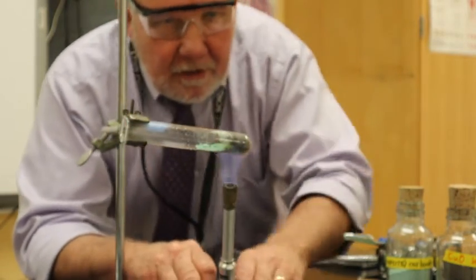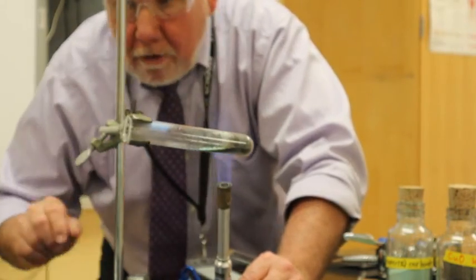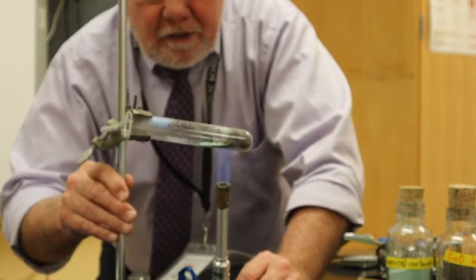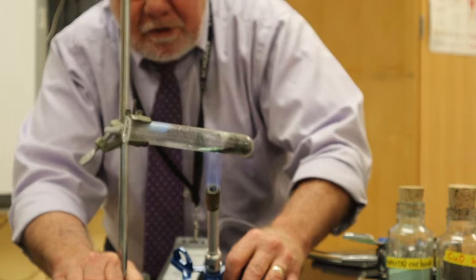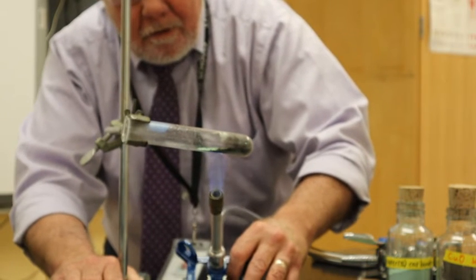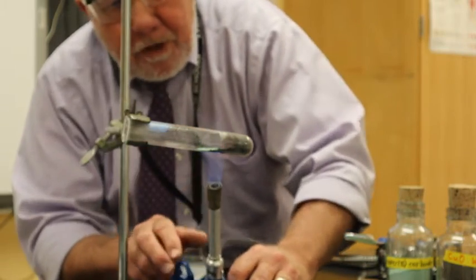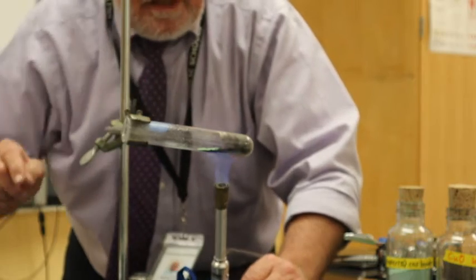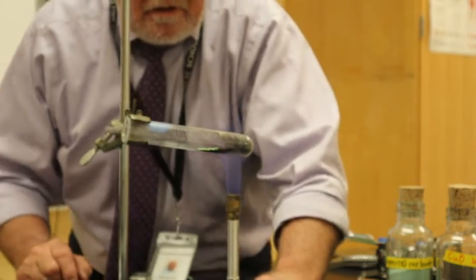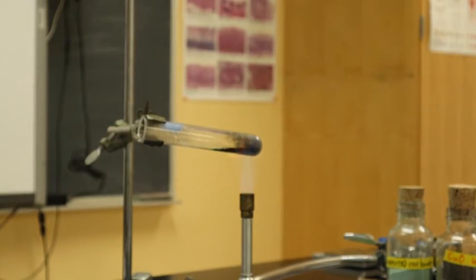I'm going to take this, and what I want to do is mix it up a little bit. I want to distribute that copper carbonate in there so that it all gets heated. So I jostle this a little bit. And I want to move my burner so the very tip of the flame is there. Yes, that looks like water moisture. I don't know if you can see that. Again, I'll see if I can zoom in a little closer on that so you can see that. But all this looks like condensation there. Let's see if we can zoom in.